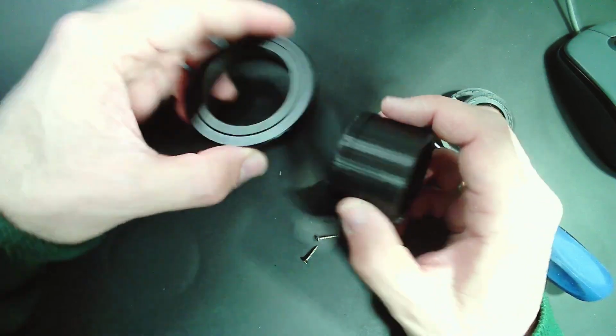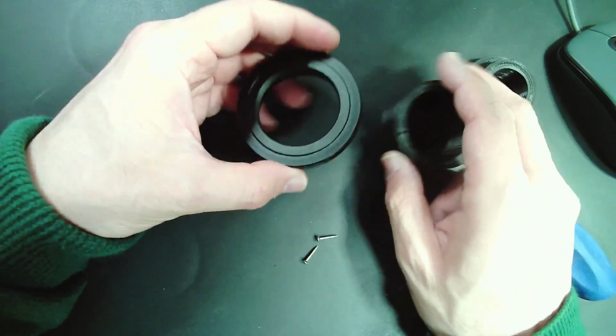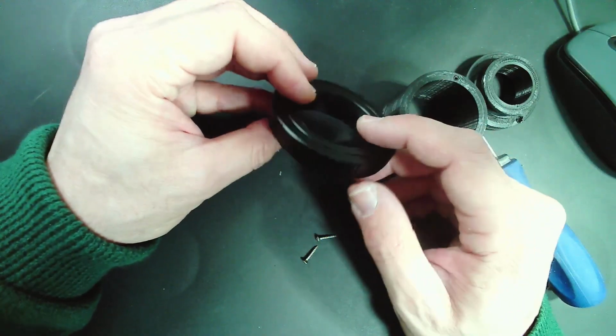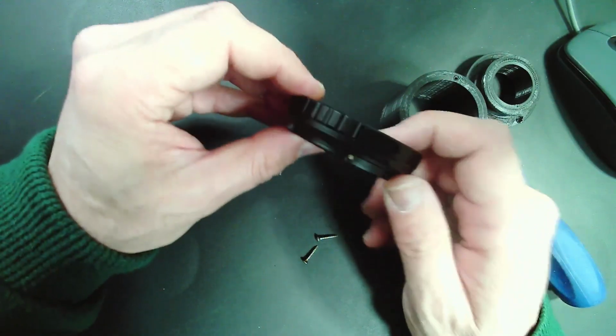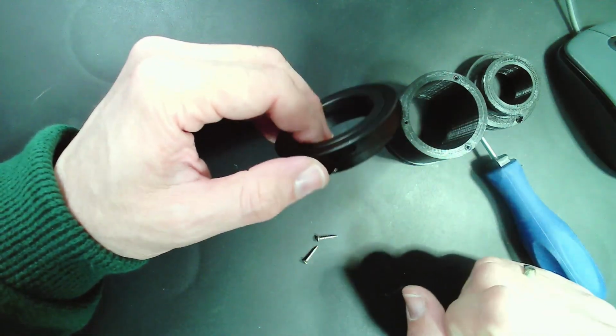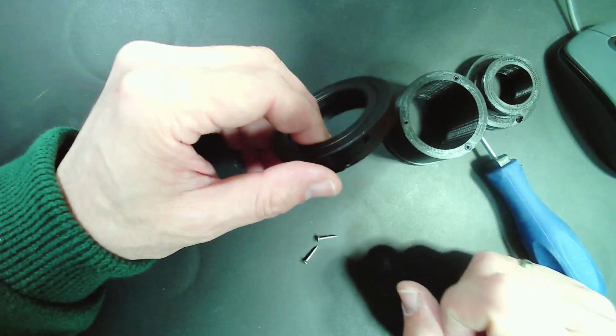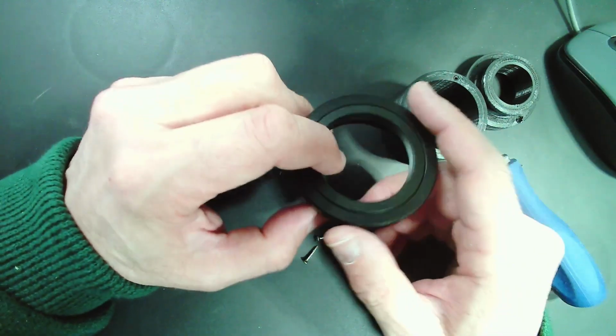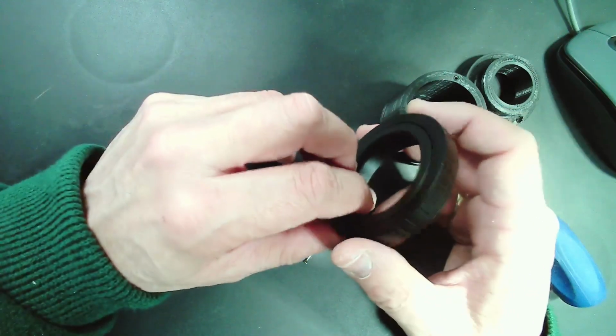So how do I fit it into the T2 adapter ring? And this is one that is camera specific, and you have to make sure that those T2 adapter rings actually also exist for your camera, because for some camera models they might be difficult to obtain. But these are not microscope specific. People who have telescopes, for example, they also use them.